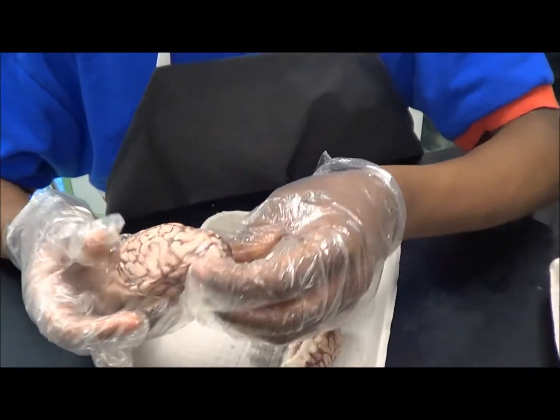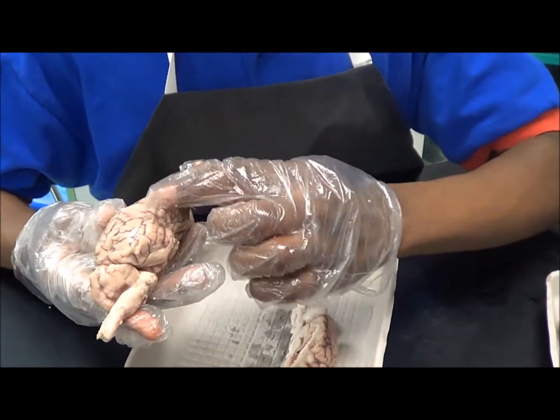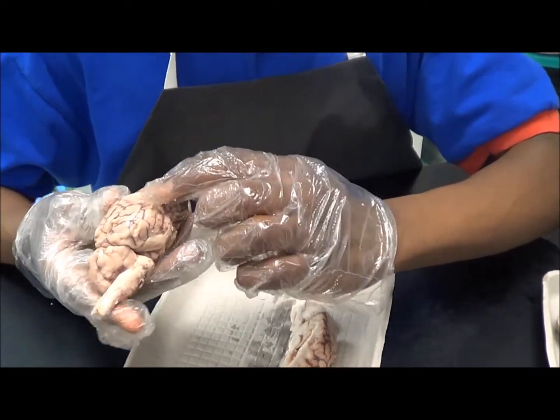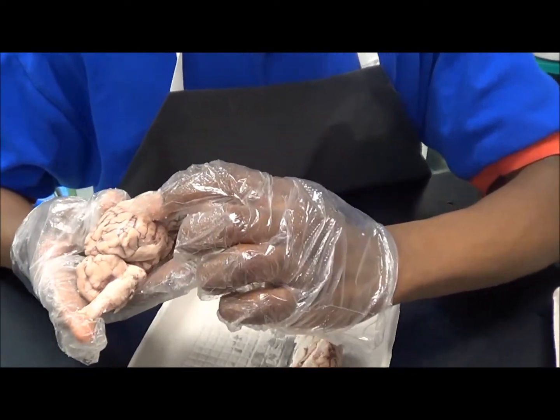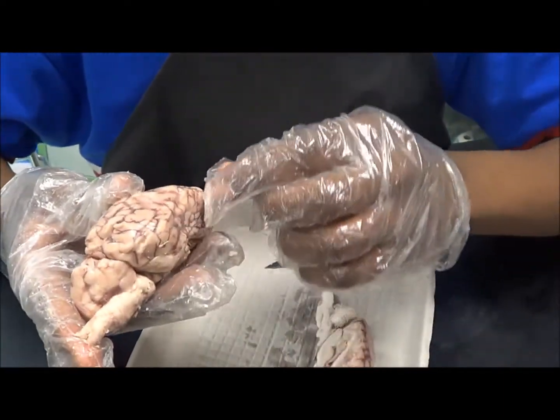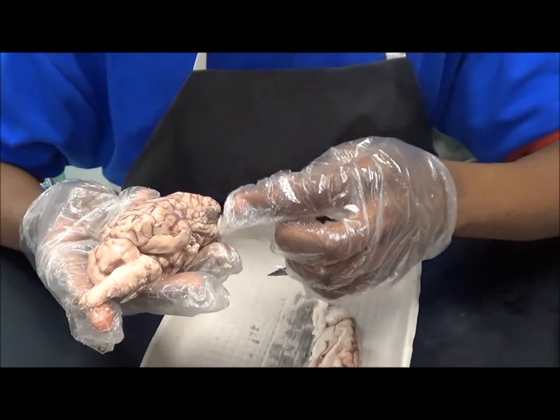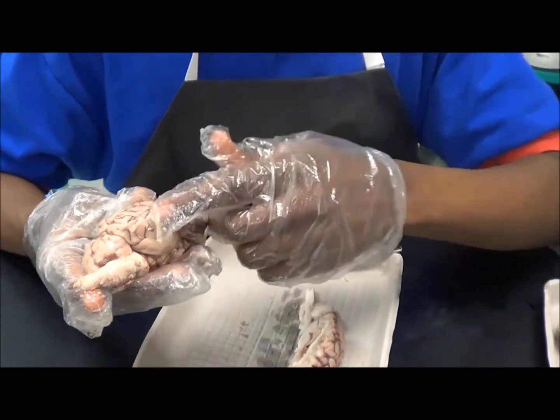Then as you flip it over, you'll see these little ridges called the gyri, and then you'll see grooves in the brain called the sulci.